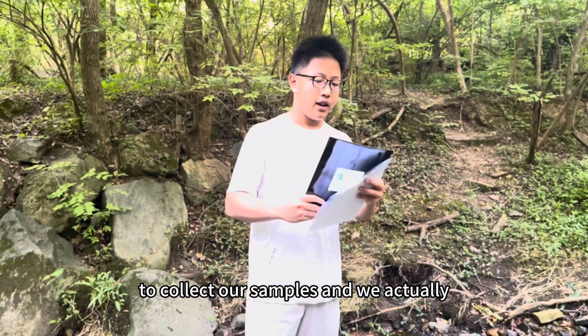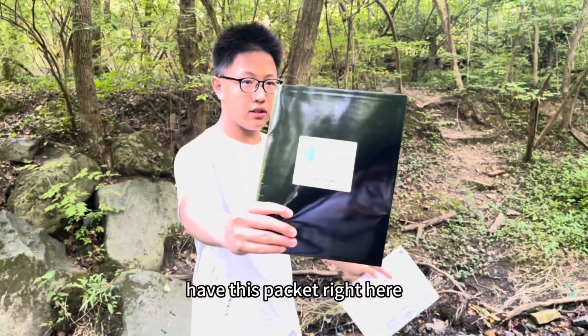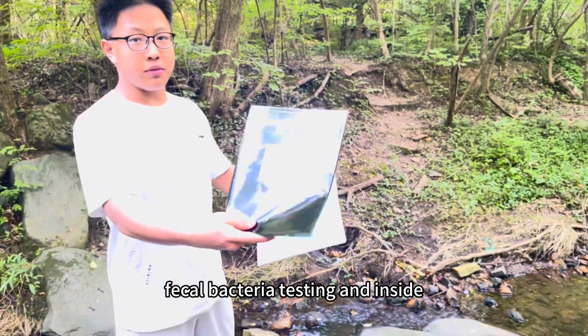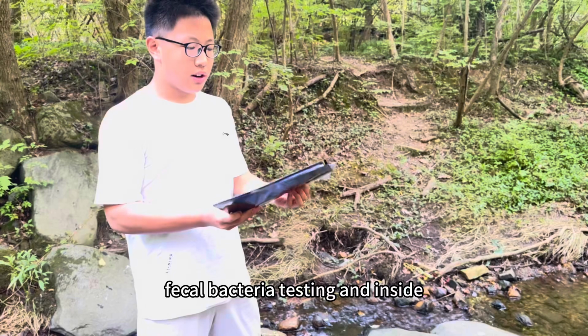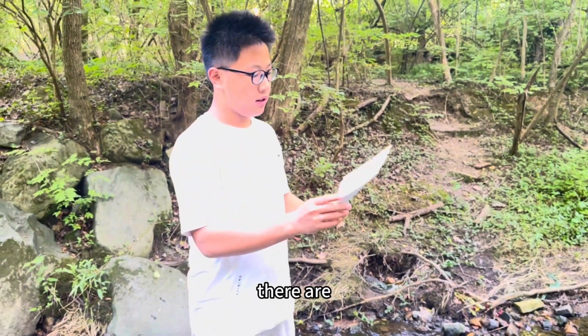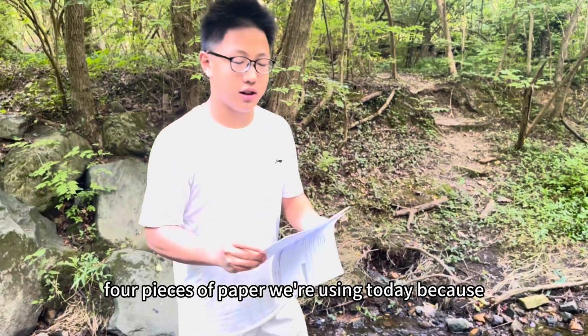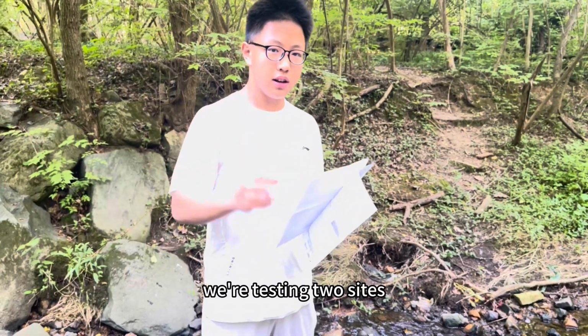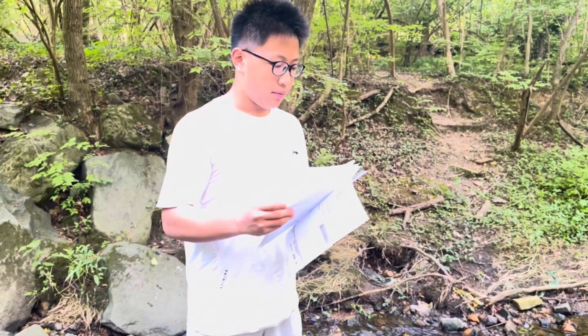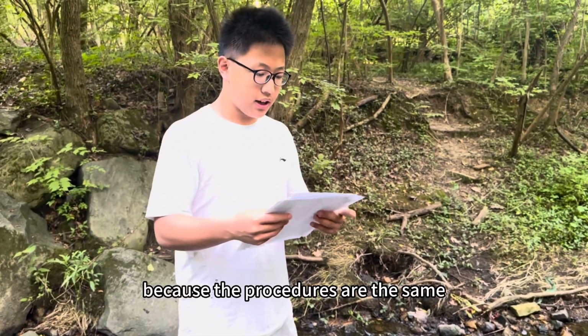And we have this packet, which says Little Falls Watershed Alliance fecal bacteria testing, and inside there are 4 pieces of paper we're using today because we're testing 2 sites. The video only shows one of them because the procedures are the same.